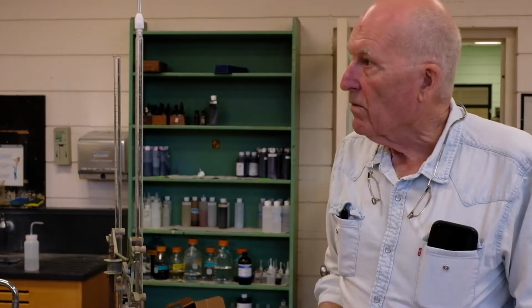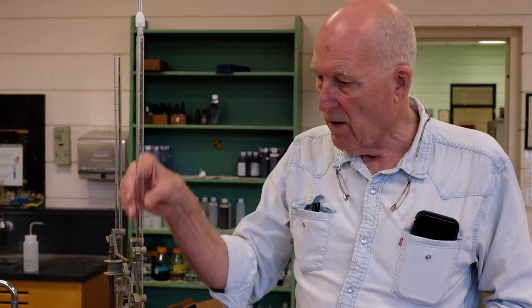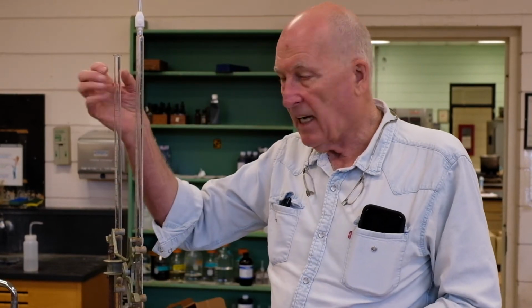Okay, so this is the last chemical test we're going to do on the sauerkraut. Some of you have had chemistry already. You know what a burette is, and it's a titration device, and it's got numbers and scales. So to do total lactic acid, we're going to use a 10th normal sodium hydroxide.